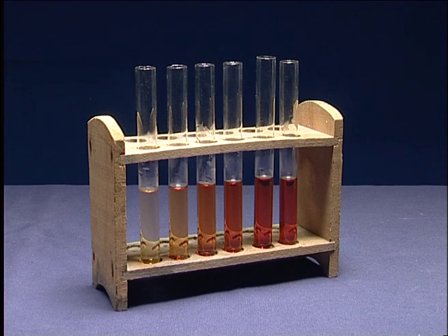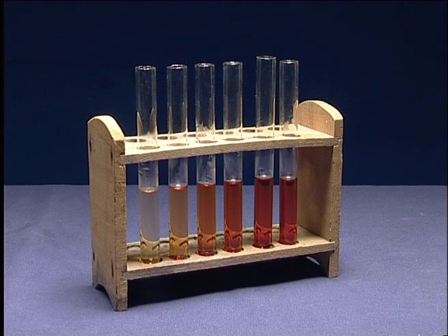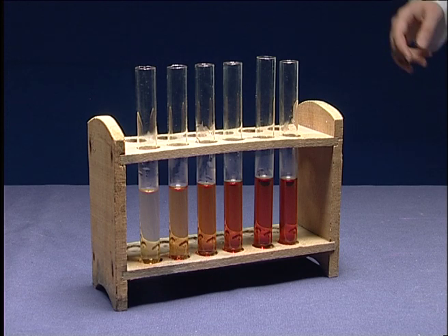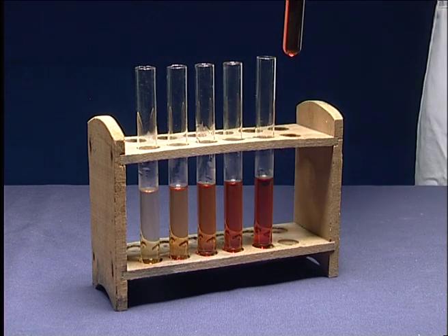Determine the concentration of ferric thiocyanate in the test tubes by comparing them with the standard test tube. Compare the test tubes by looking at the colors from the top of the tubes.